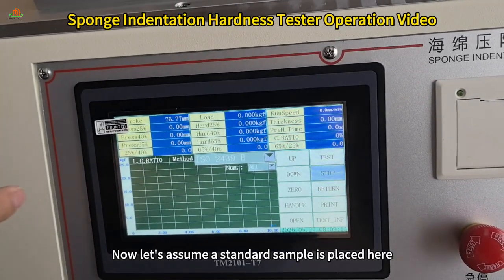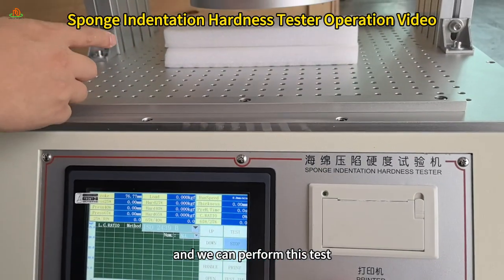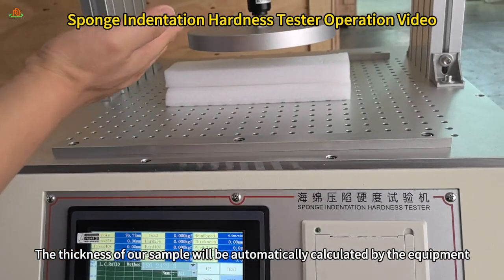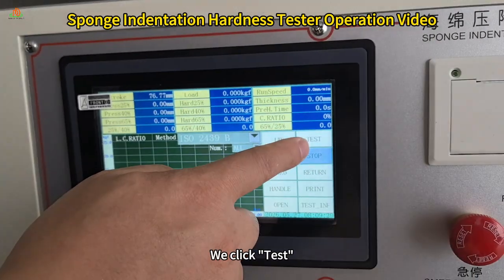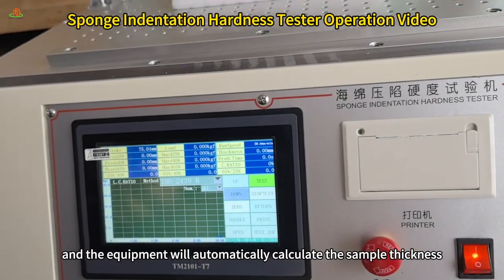Now let's assume a standard sample is placed here, and we can perform this test. The thickness of our sample will be automatically calculated by the equipment. Here is a thickness value, currently showing no thickness. We click Test, and the equipment will automatically calculate the sample thickness.